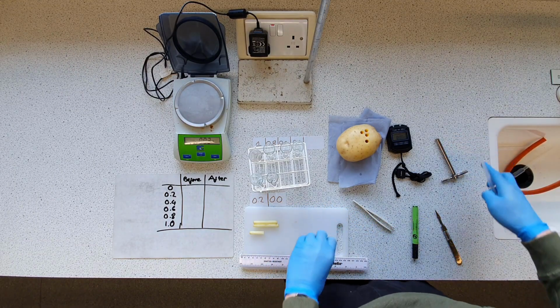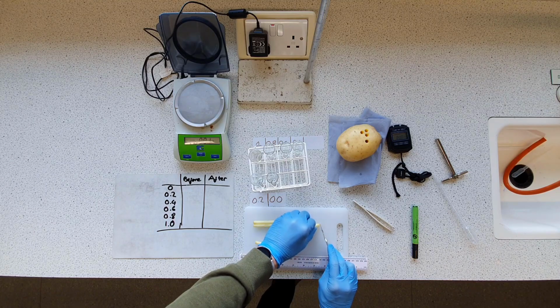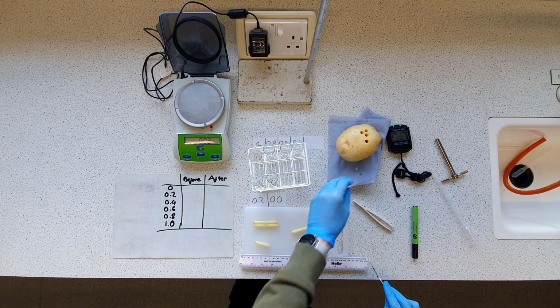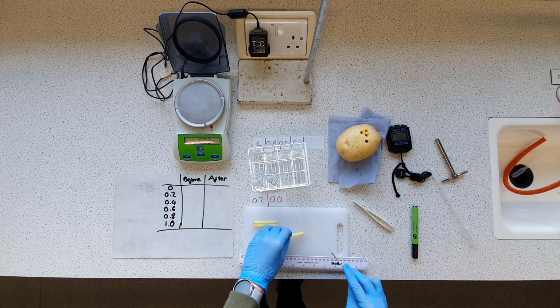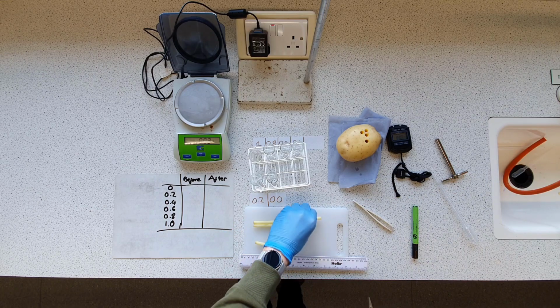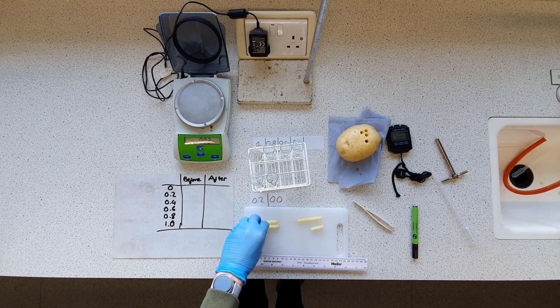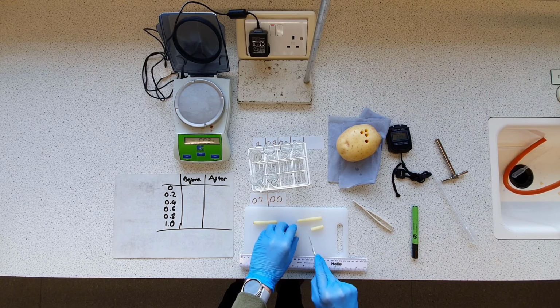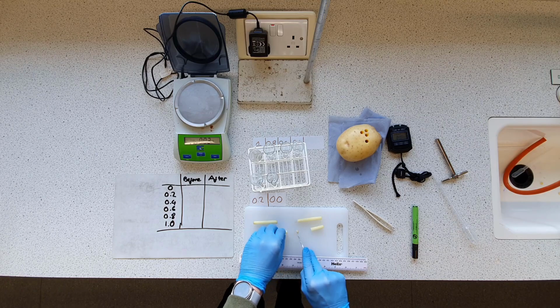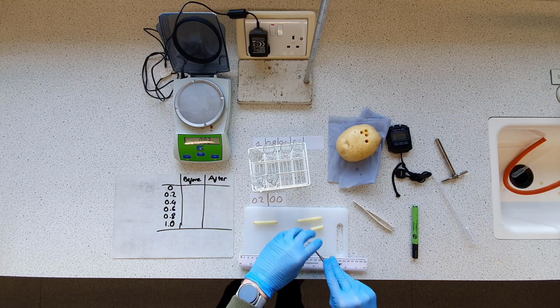Nice noise there. Great. Right, so straight away, I'm going to use my scalpel here to remove the ends, just snip the ends off, try and cut it as perpendicularly as possible. I'm going to chuck that away. I've got a bucket off screen, don't worry. Won't be perfect, but it should be good enough for our cores. And then as perpendicular as possible. Like that. Oh, that's just a bit of leftover skin. I'm not sure if that little core there is exactly 2 centimeters, but I'll be surprised if it is.